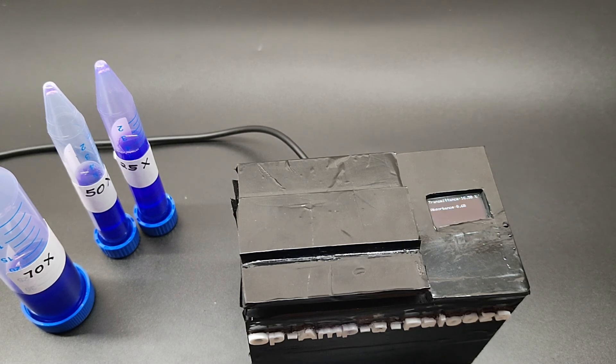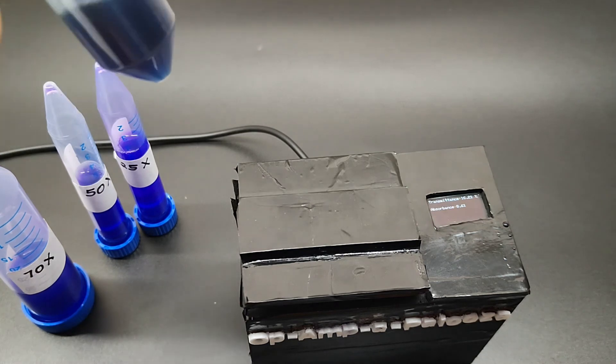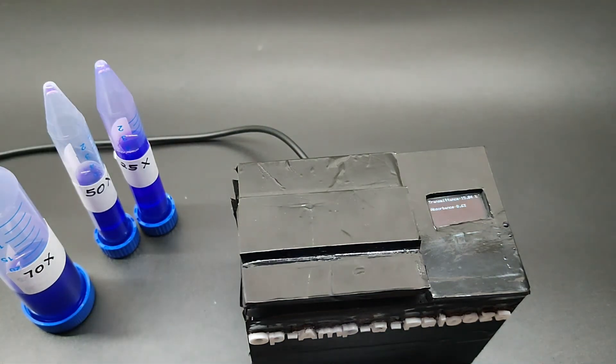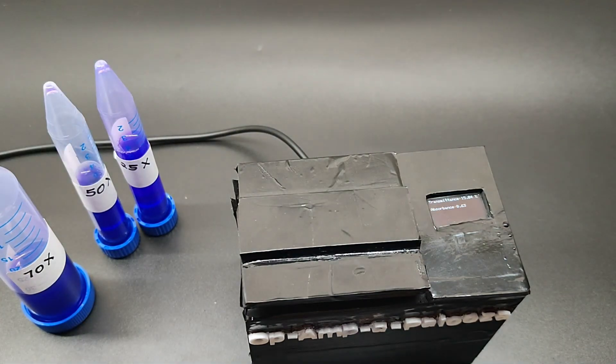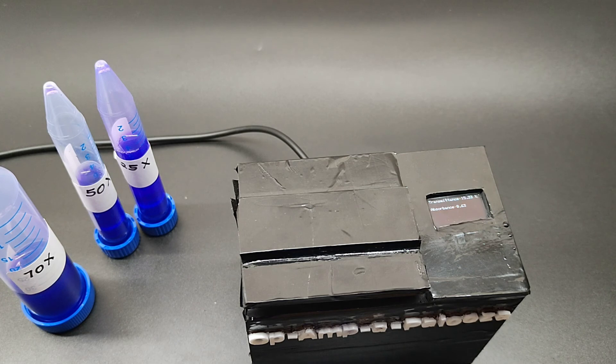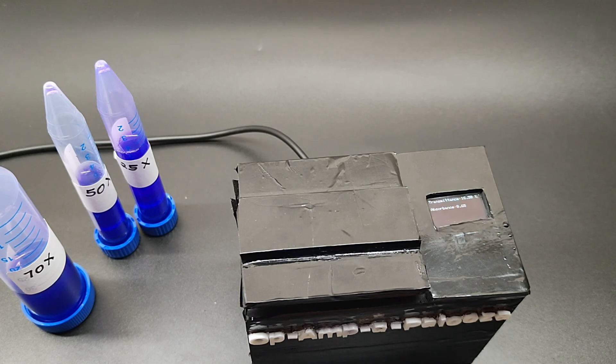This completes the four-solution test. I am going to generate a graph to check the results.